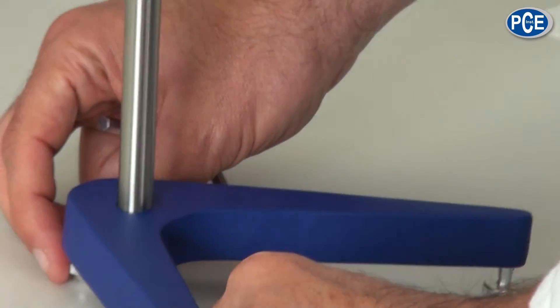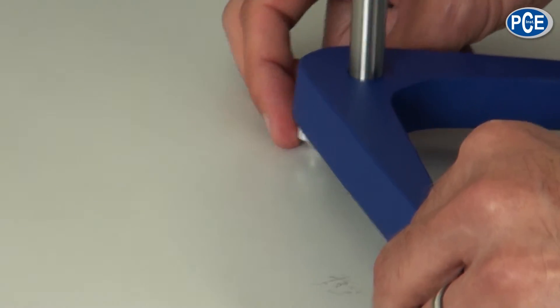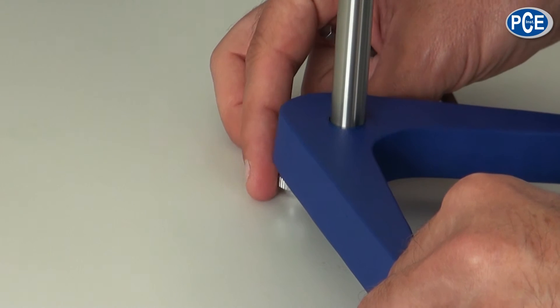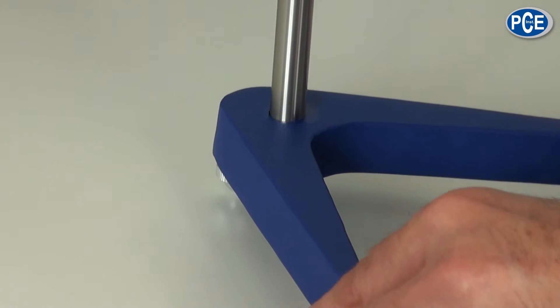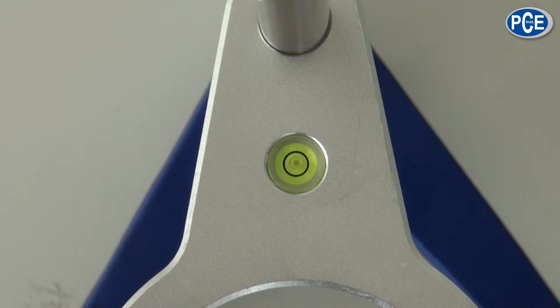Then the stand can be leveled. For this the three turnable feet can help. Now the stand is leveled and is ready to use.